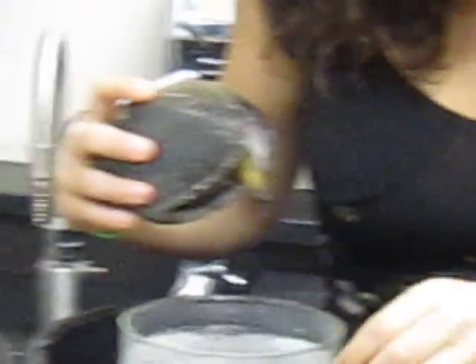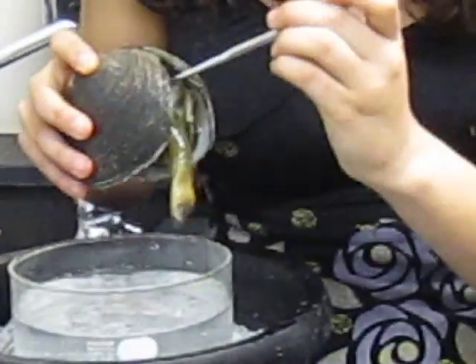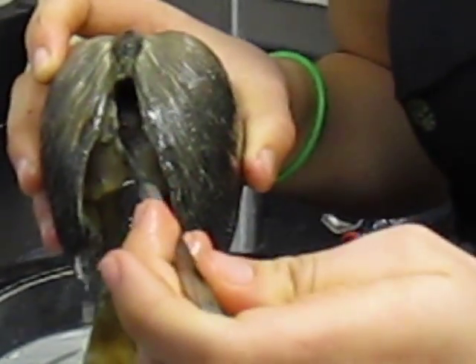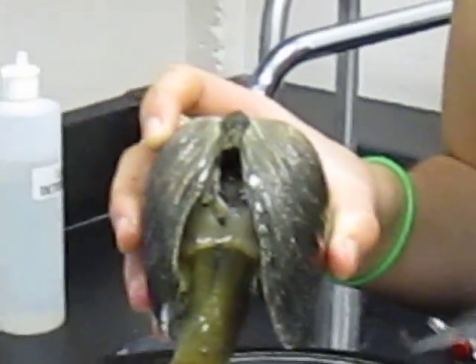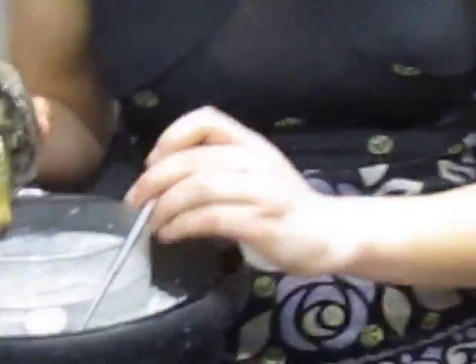Okay, and so next we open up. So anyway, after it goes into the mouth, it goes into the digestive organs, which are in the visceral mass. You guys are gonna have to come up in twos again to see this really close. What they've done is cut open the visceral mass, so normally you would not be able to see it, but there are a lot of really important organs and structures within the visceral mass, including the digestive organs. So you've got mouth to esophagus, esophagus to stomach, where you have these digestive glands. And they'll help to break down nutrients and do absorption.